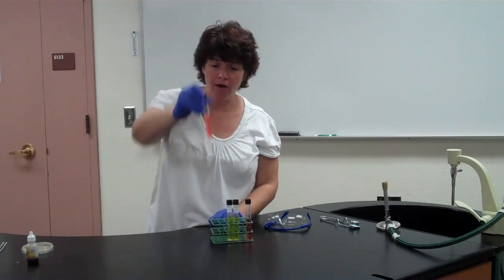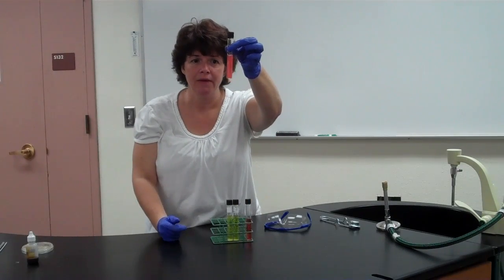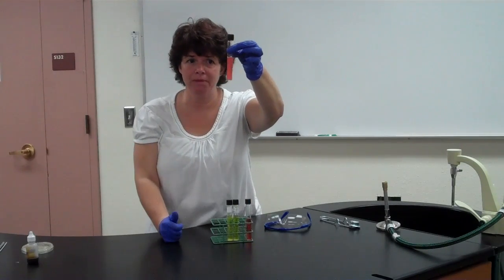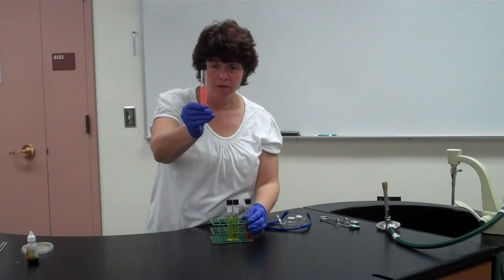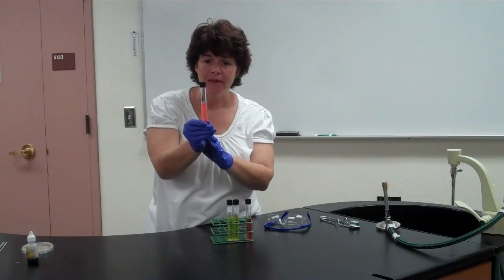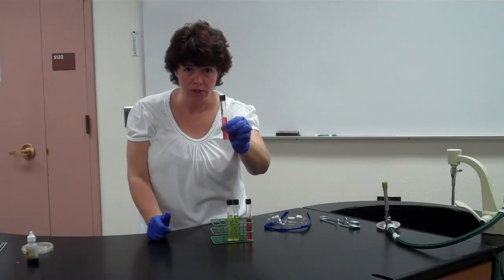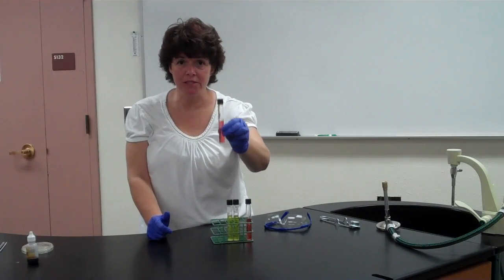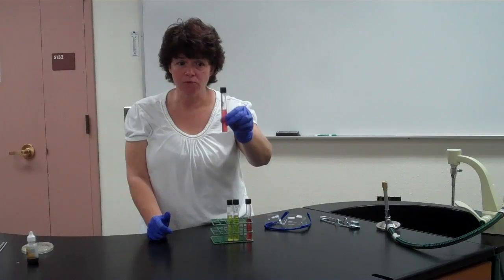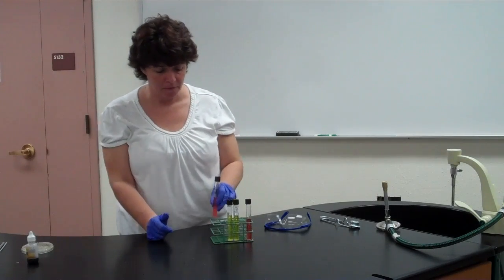Well, even if it did, always look for growth first. And you can see growth because it's cloudy, it has turbidity, there's some sediment, bacteria everywhere. Now this right here is positive for growth, but negative for fermentation because it did not change color. That means that this particular bacteria does not ferment sugar, it uses it for normal cellular respiration. It goes through oxidative processes where it goes through cellular respiration, not fermentation.